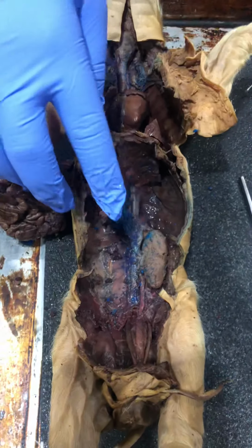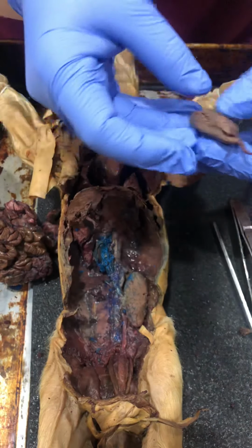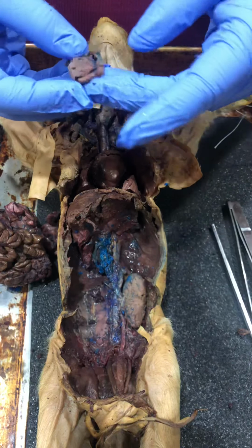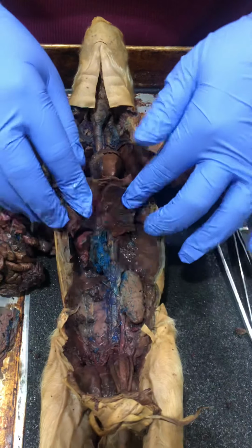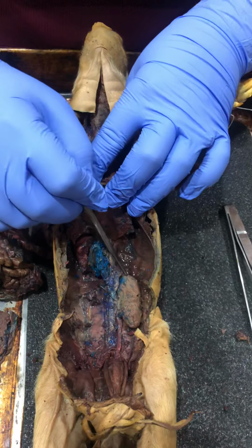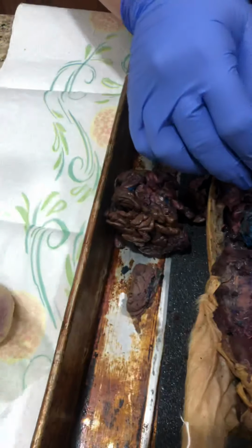So I cut that tissue out of it to go ahead and expose the kidney. This is my left one, and I actually dissected already out the right one, but it was for the picture of the assignment. I had to cut out the right kidney, and then here is the left kidney, as you can see. So there's 8 structures I have to go ahead and name. Right here you can see the kidney, and I already took out the right one. I already put it aside.